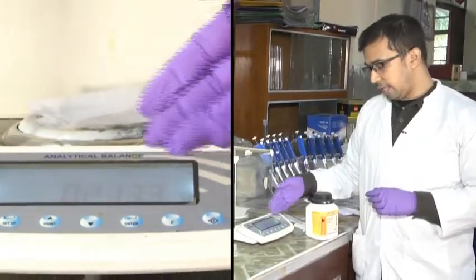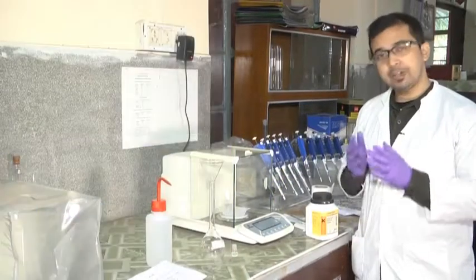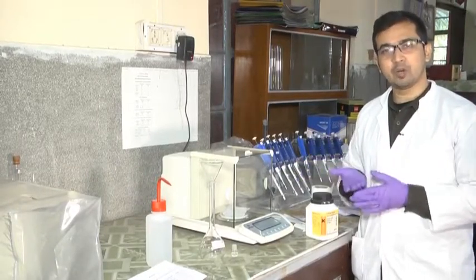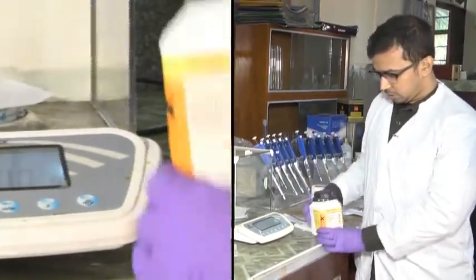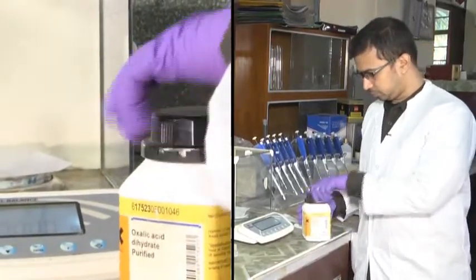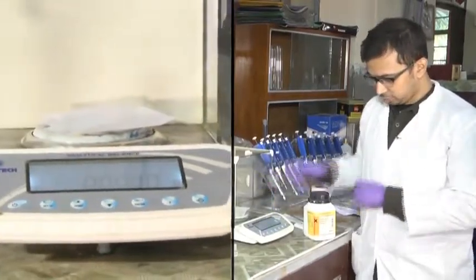Here we can see it is showing some weight of the butter paper, so we have to tare this. Every time you use any base like a butter paper, or any weighing vial, always do taring first. The tare function of the instrument is very essential. Once this value reaches 0, we will start adding the solid oxalic acid.